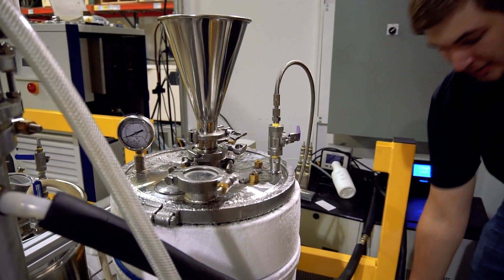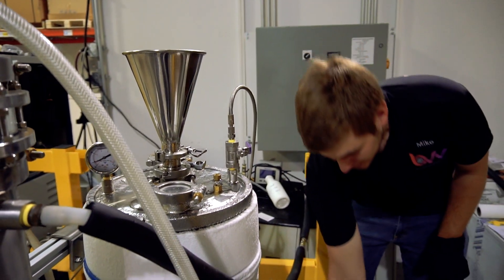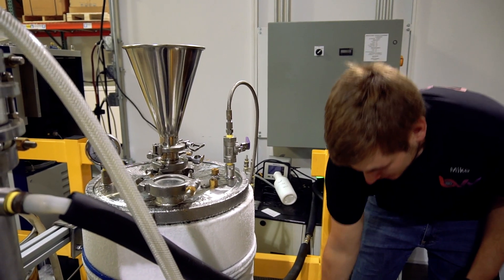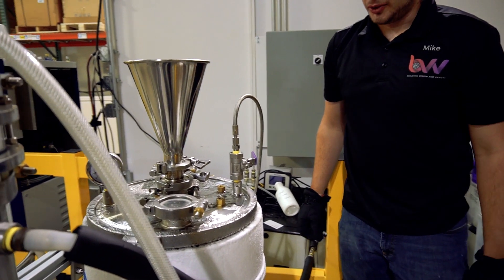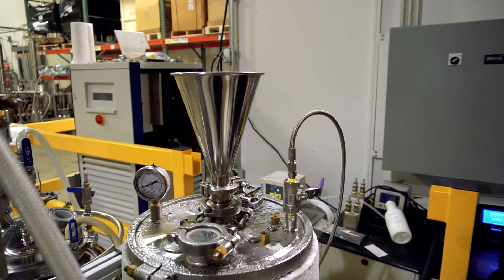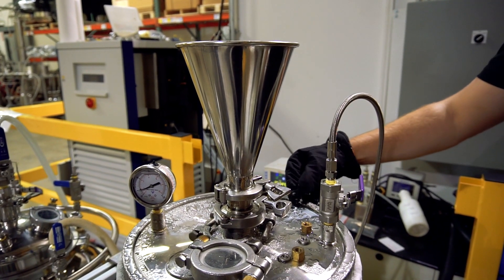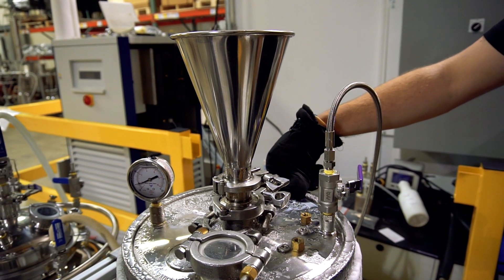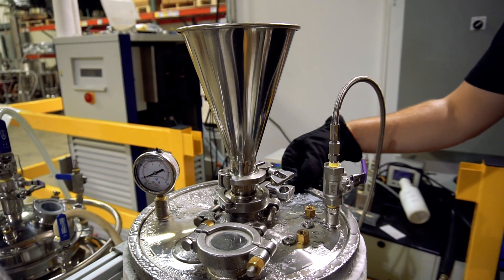We're here with some winterized material at negative 80 degrees Celsius. This is a mixture of ethanol and our crude oil extracted through a butane system. We're going to start by putting it into this column right here — this is our refinement filter — going to take out a lot of the fats and waxes from the material, then from there it will be further transferred.